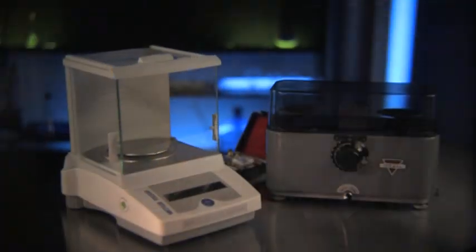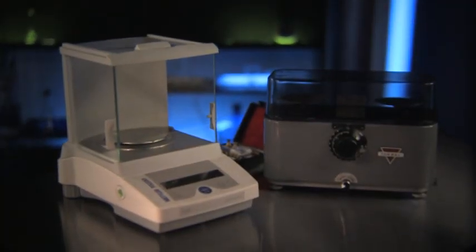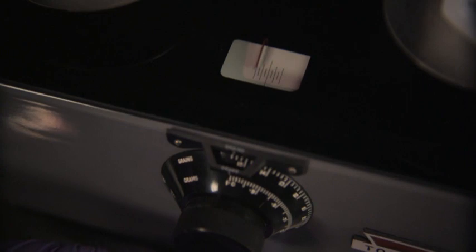There are several pieces of equipment that are used when compounding the medication forms we just learned about. We'll focus on those you use most often. There are two types of scales, or balances, that are ordinarily used when measuring ingredients to be compounded. Which balance you use can vary depending on where you work, so it's important to understand how to use both. Using these balances properly ensures the correct dosage is prepared.